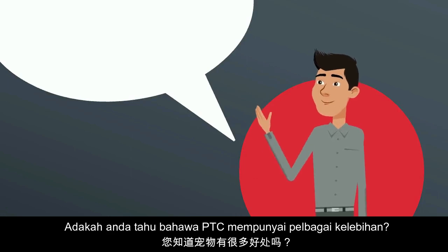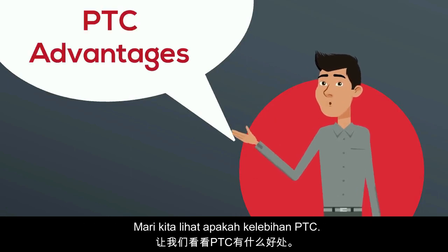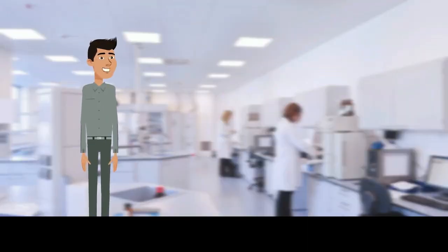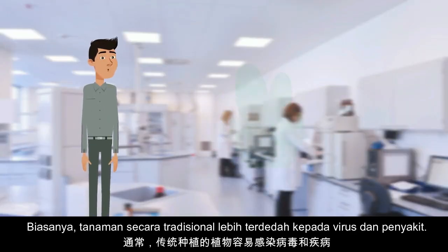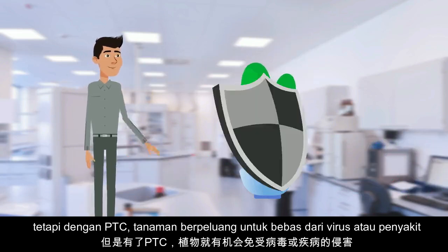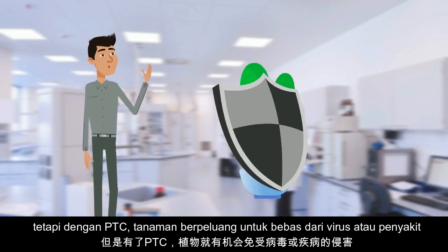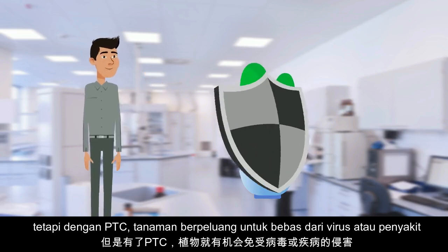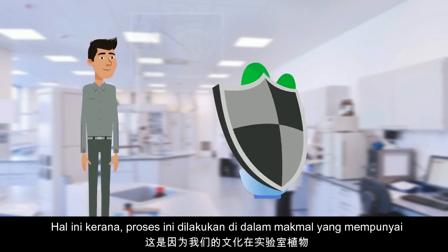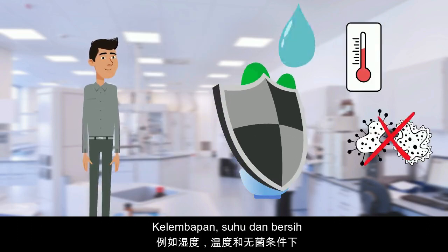PTC has a lot of benefits. Traditionally grown plants are prone to viruses and diseases, but with PTC, plants have a chance to be free from viruses or diseases. This is because we culture the plants in the laboratory with controlled conditions such as humidity, temperature, and cleanliness.